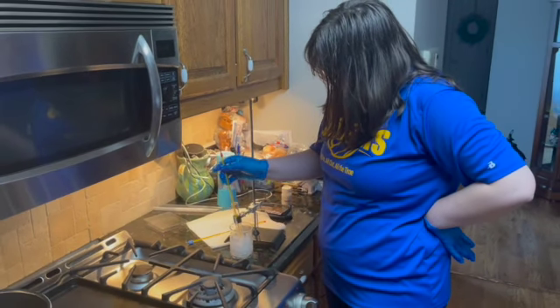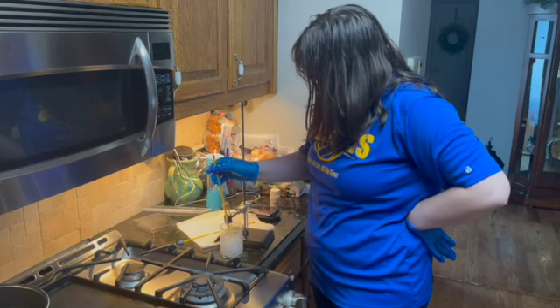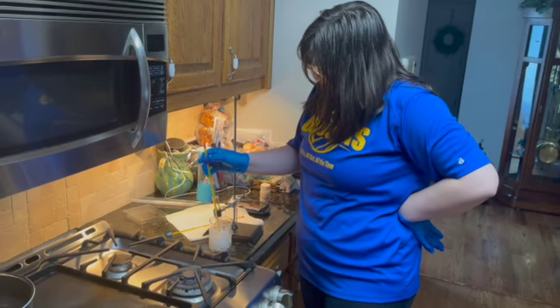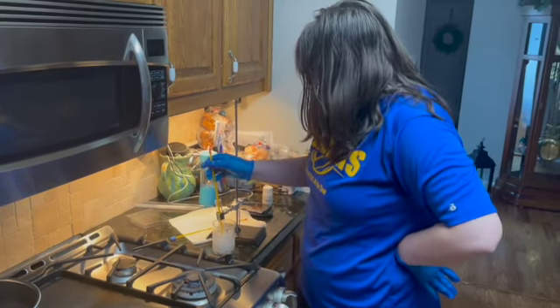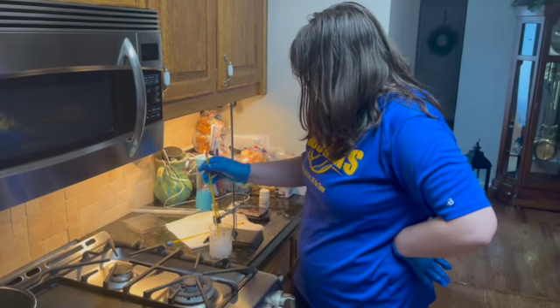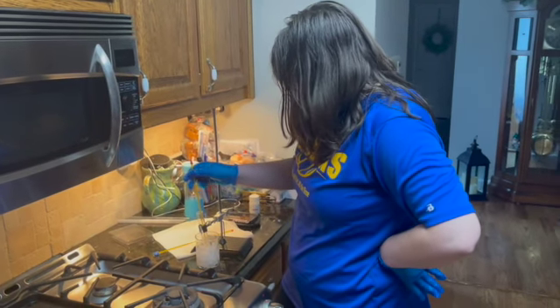I wonder, because of how fast the mixture between naphthalene and paradichlorobenzene melted, if it will freeze faster as well, but it almost seems like it's not the case because it's getting pretty close to that time.